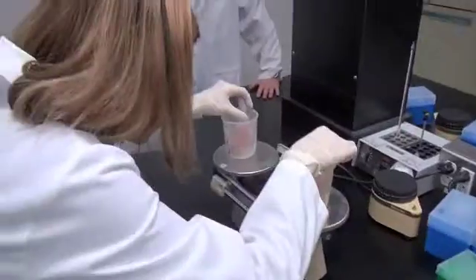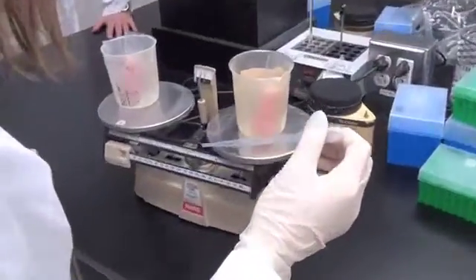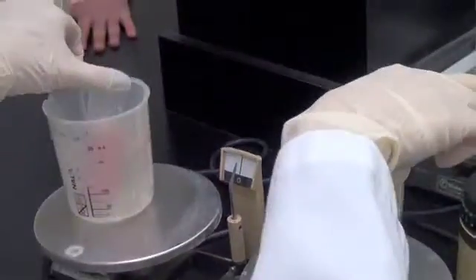Challenger Karate is balancing a crude homogenate on the double beam balance. That doesn't look balanced at all. That's right. She has to use a transfer pipette and transfer some volume from the heavier tube to the lighter tube. Taking little by little is the best way, making this step short and painless.